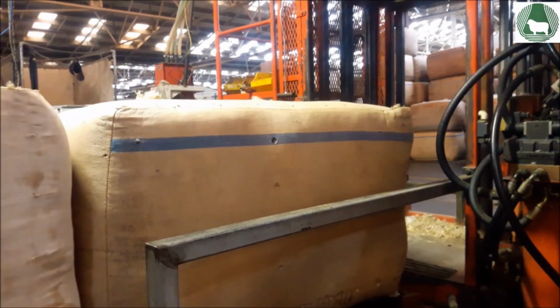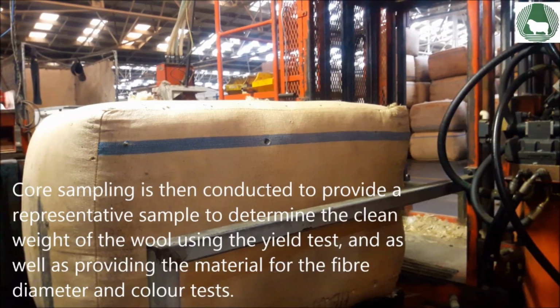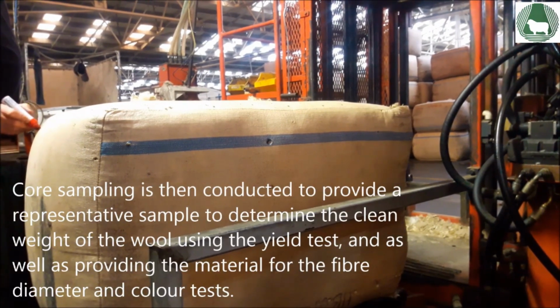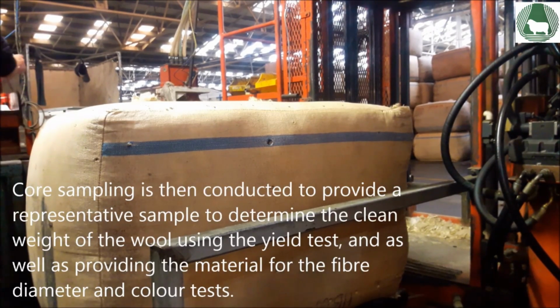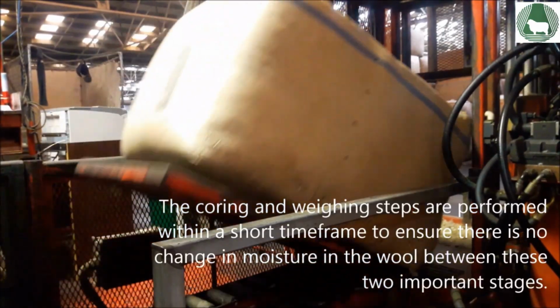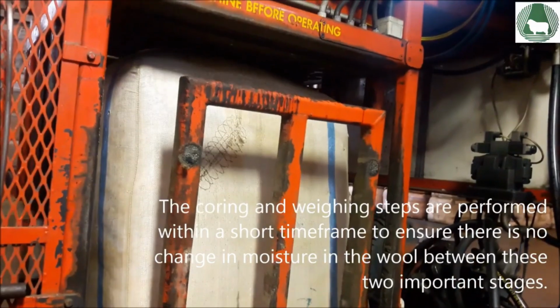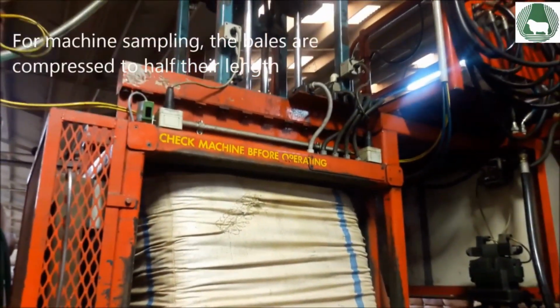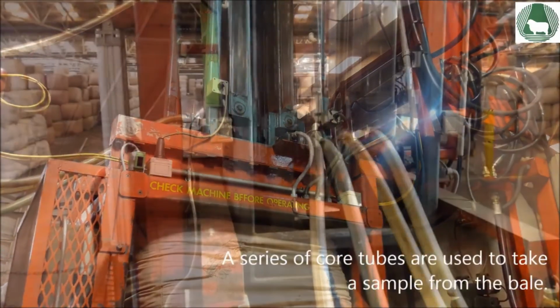After grab sampling, the bale is weighed. The weight of each bale is recorded in whole kilograms. Core sampling is then conducted to provide a representative sample to determine the clean weight of the wool using the yield test, as well as providing the material for the fibre diameter and colour tests. The coring and weighing steps are performed within a short time frame to ensure there is no change in moisture in the wool between these two very important stages.